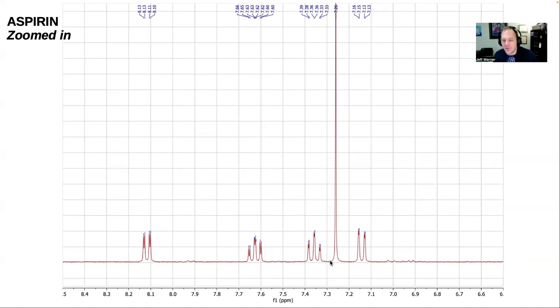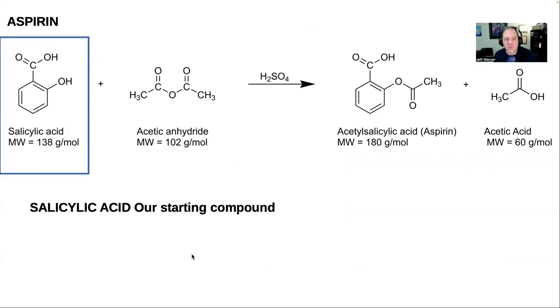Of course, we're counting backwards here, so it's to the right of 7.3. That makes it 7.26. And then we've got this triplet of doublets. In other words, these little peaks seem to be split into 2, and then split into 3 here, and we've got another cluster of peaks here, and another cluster of peaks out here. The locations of these peaks from left to right on the x-axis is what we're paying attention to, and that's what we're going to compare.